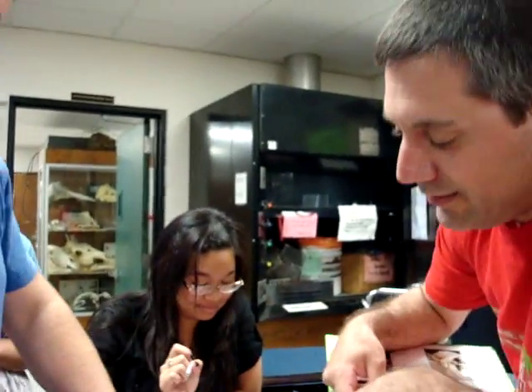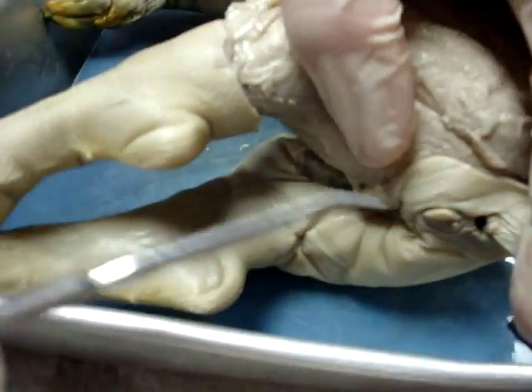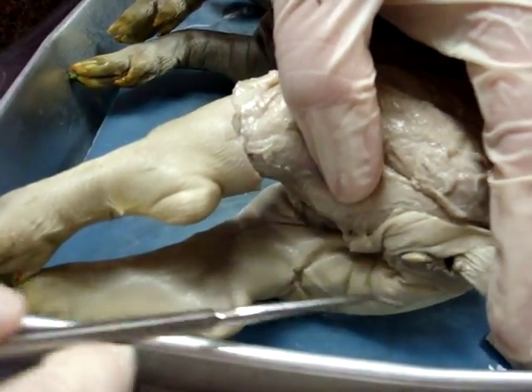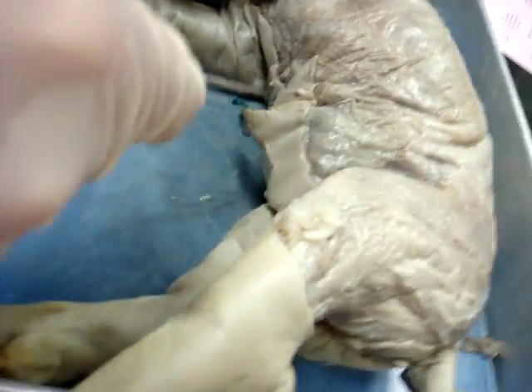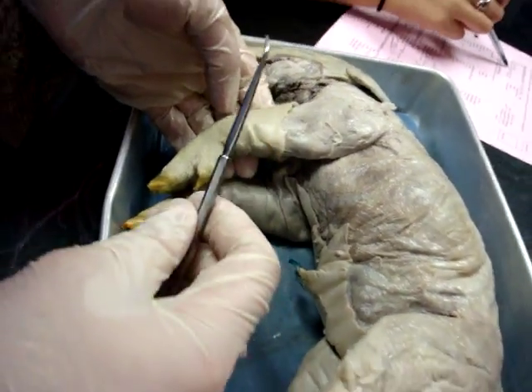Alright. Get the butt. Show me your urogenital opening. Your urogenital opening is right beneath it. And your urogenital papilla? That's that little nub — it's like the clitoris. Where are your mammary glands? These are the nubbins. Those are your mammary glands, good.